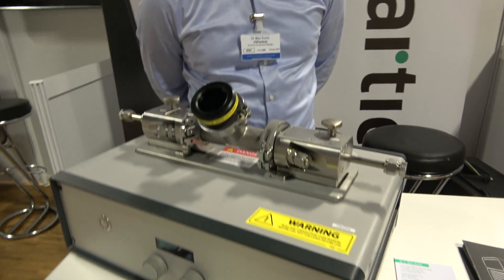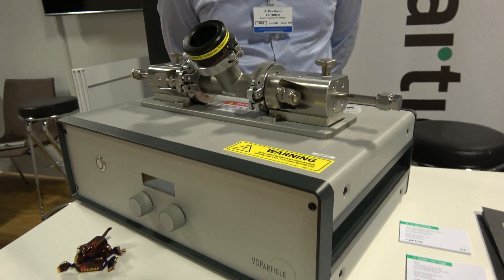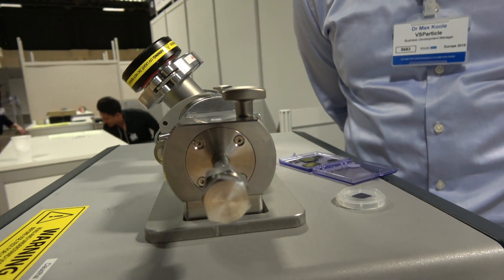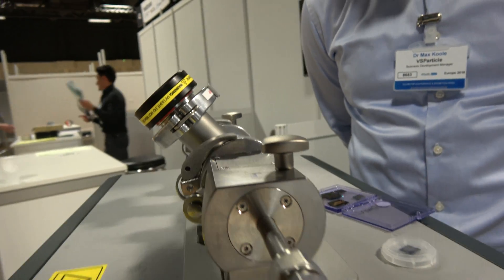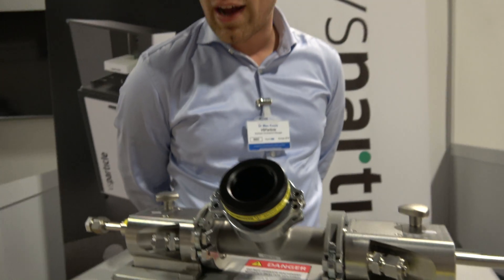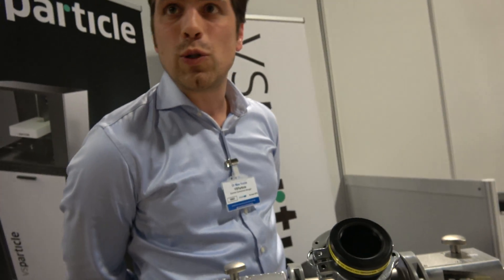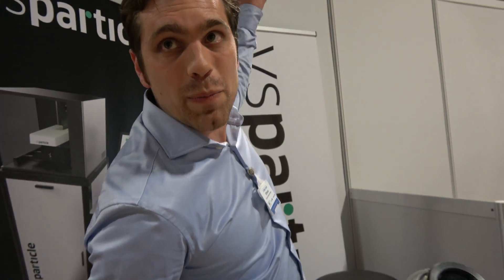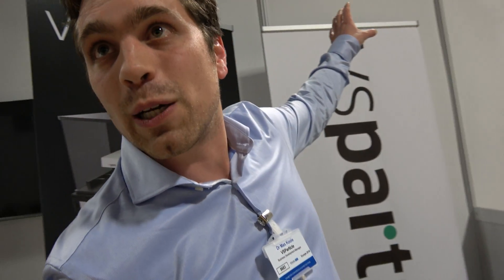And you have a machine right here. Yes. This is our nano-aerosol generator. What we do, we do a lot of what the people at the other side do, but they do it with inks and we do it with aerosols.